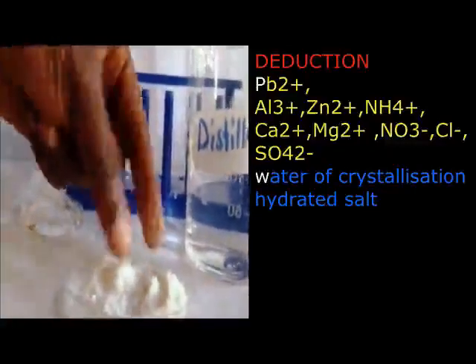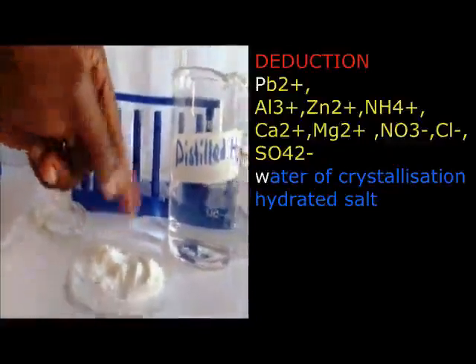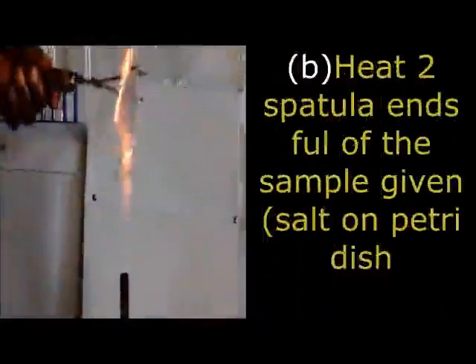Now, after looking at that point of the appearance of the salt, let us try to look at what we are calling now the heating point.